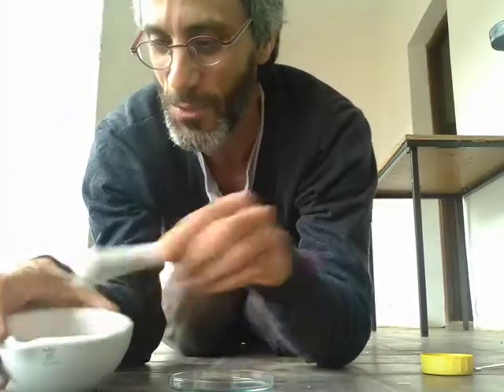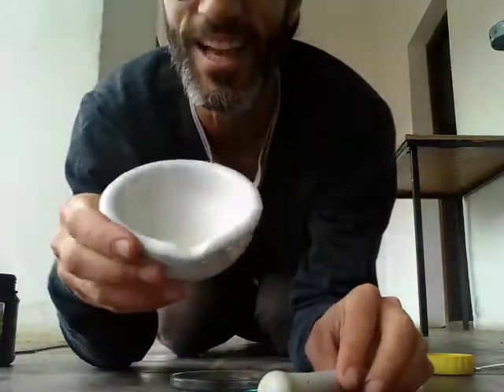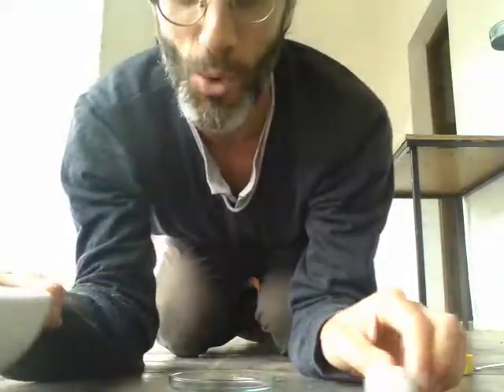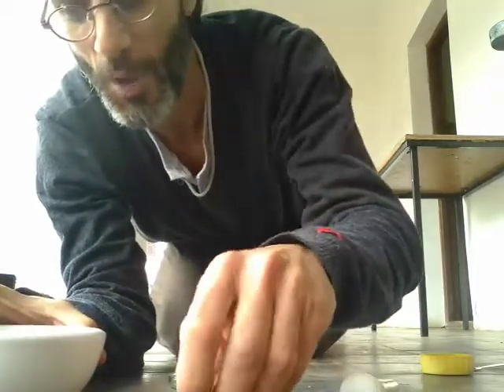Okay, guys, this is the last chemical reaction that we're going to see today. And this one involves iodine. Okay? So you've got these little balls. Oops, I made a bit of a mess here. Never mind, clean it later. Okay? We've got a bit of iodine.